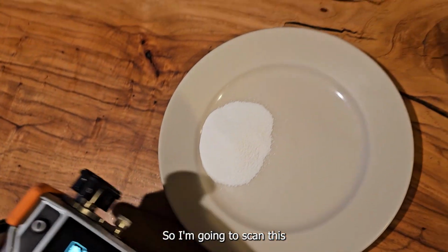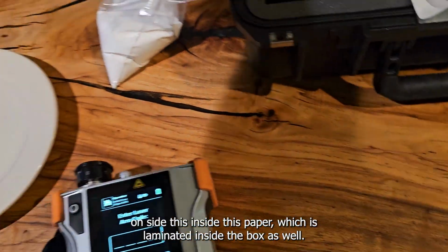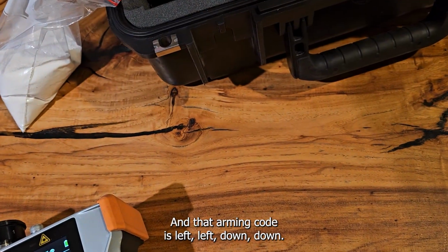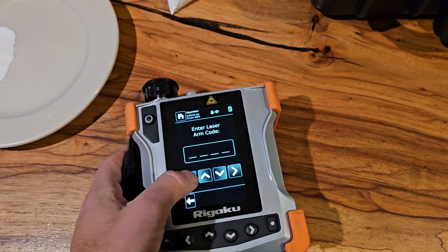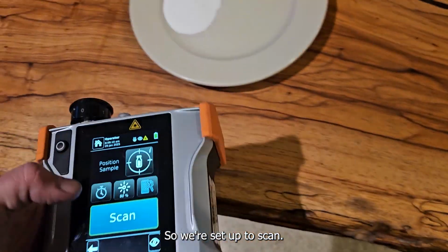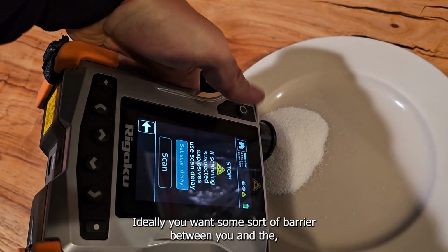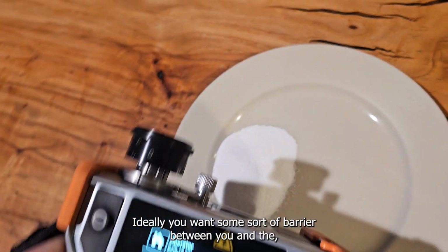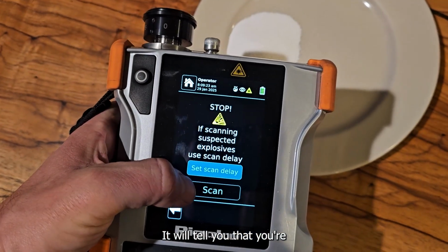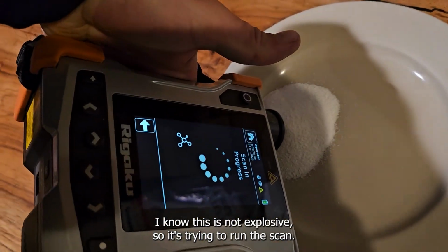So I'm going to scan this. I have to do the arming code the first time I scan it, which is located inside this paper, which is laminated inside the box as well. And that arming code is left, left, down, down. So we're set up to scan. I'm going to try to scan it, and we'll see if we get any sort of result. Ideally, you want some sort of barrier between you and whatever you're scanning, so it doesn't get everywhere, but you don't need that. It will tell you, without a delay, that you need to be careful for explosives. I know this is not explosive, so it's trying to run the scan.